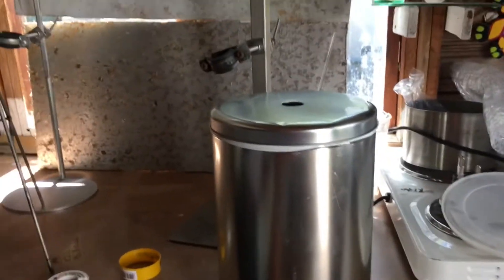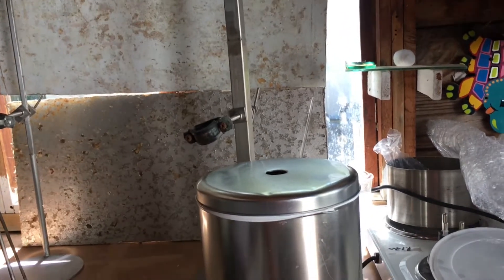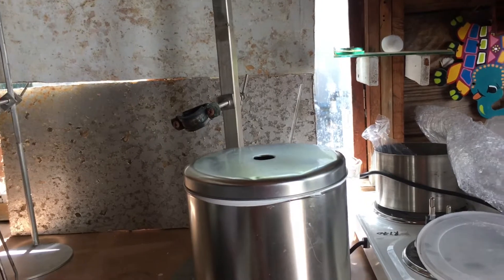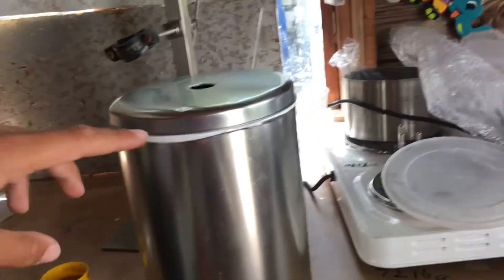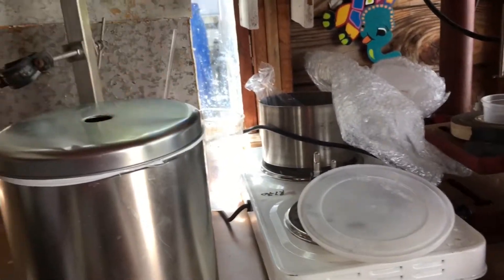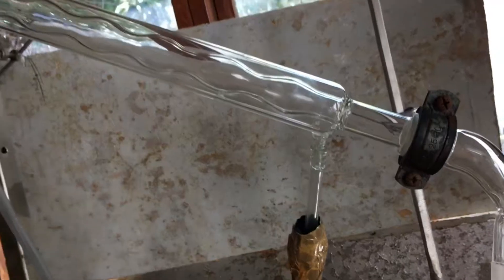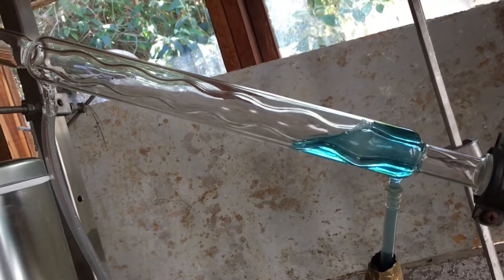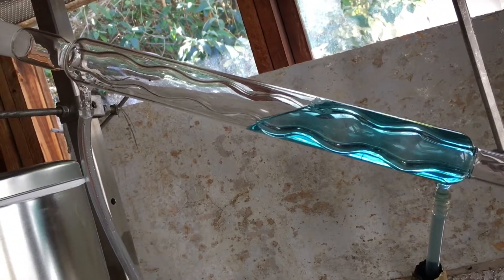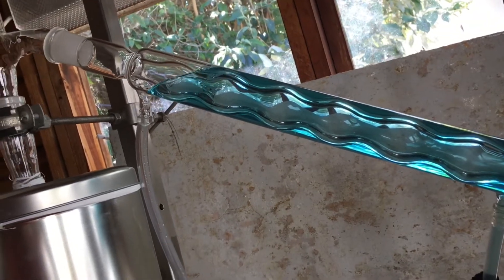Update: I have transferred 1 kg and 720 grams of sodium hydroxide into this canister. I've taken some thread tape around the sides and it's made quite a good seal — when I press it down you can feel it's quite firm. Now I'm going to put the glass joints in place. Most of the glassware is set up and I'll start running the antifreeze through the condenser. It doesn't have to be super cold antifreeze, but it helps — looks really nice.